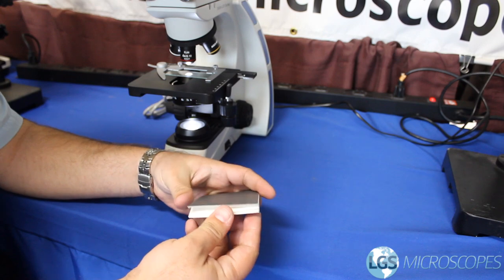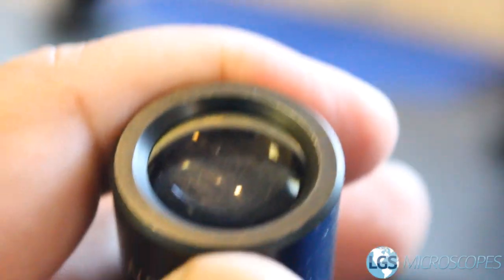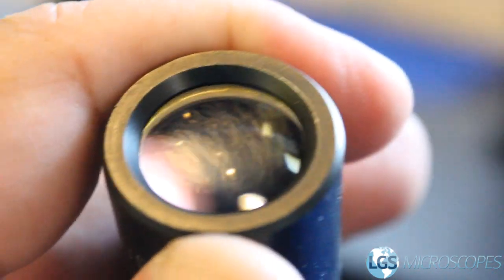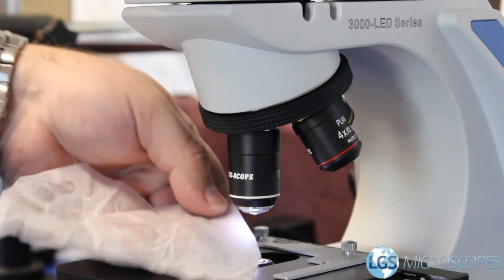The reason why you don't want to use lens paper on an eyepiece, collector lens, or condenser lens is because every lens in a microscope has a protective coating that protects from glare and light scratches, just like our eyeglasses do. When you use lens paper, paper towel, or push too hard even with a q-tip, you end up scuffing off parts of that coating and it leaves you with a really foggy, hazy look when you look through the eyepieces — and then there's nothing left to do but replace the eyepiece. That's why we recommend using q-tips. Really the best time to use lens paper or lens tissue is when you're dabbing off the oil from the bottom of the 100x objective.